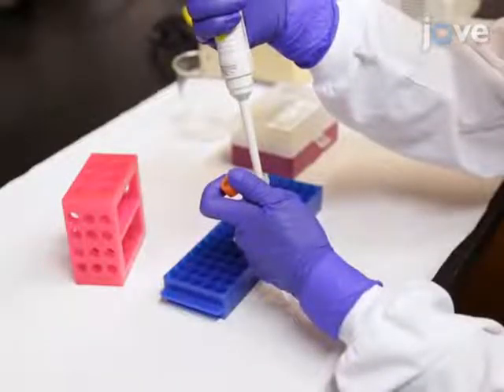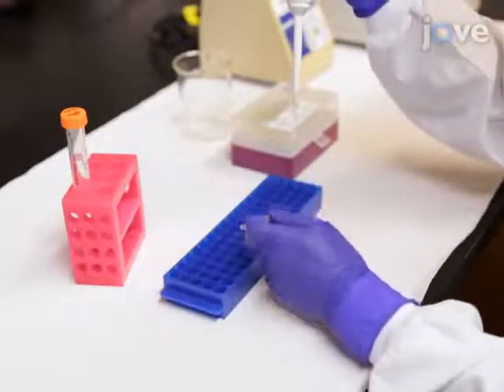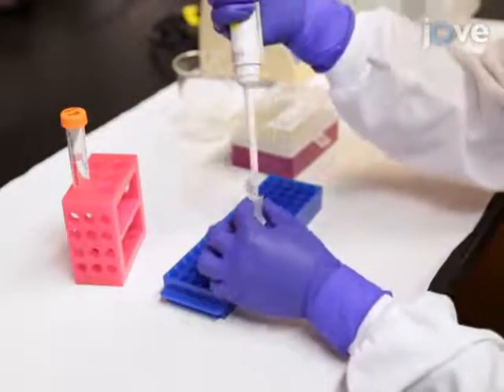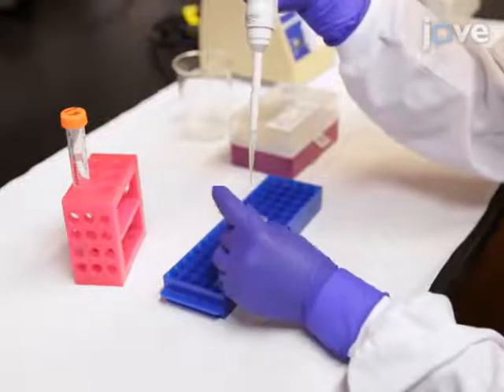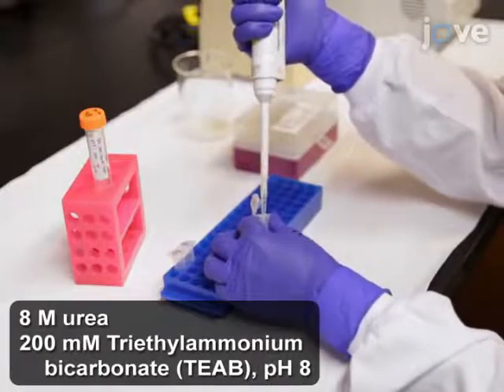Prepare 3 replicates of 100 micrograms of bovine serum albumin, or BSA protein sample, in parallel at a concentration of 1 microgram per microliter using urea and TEAB solution.